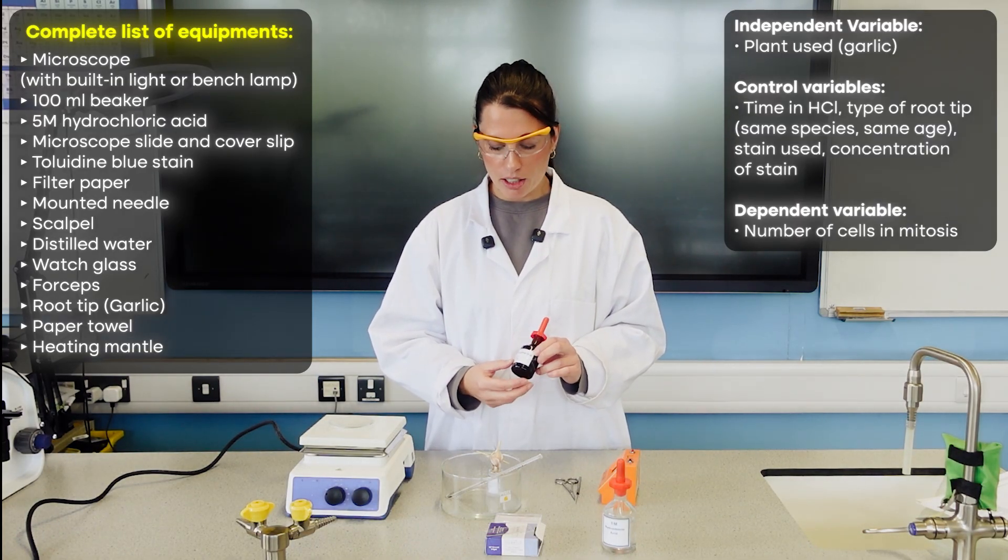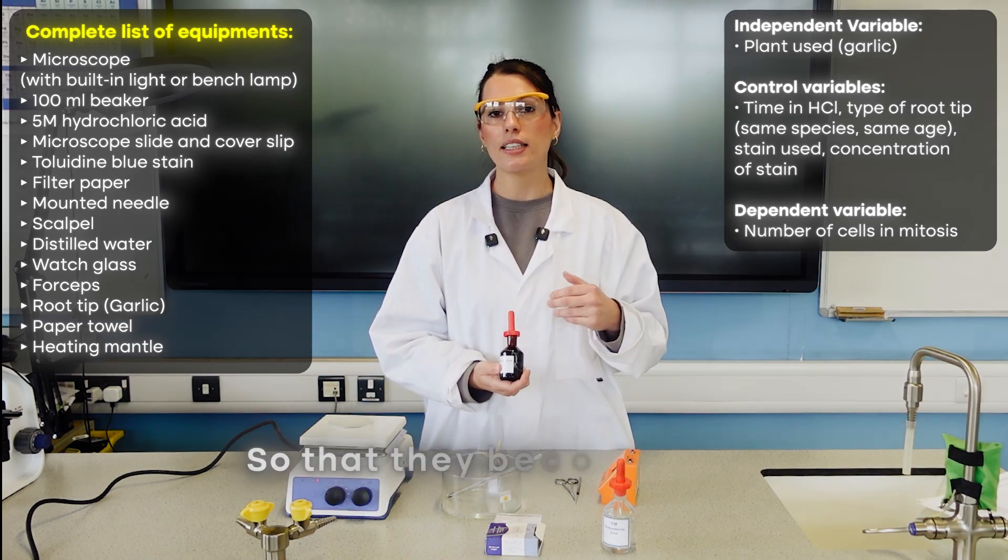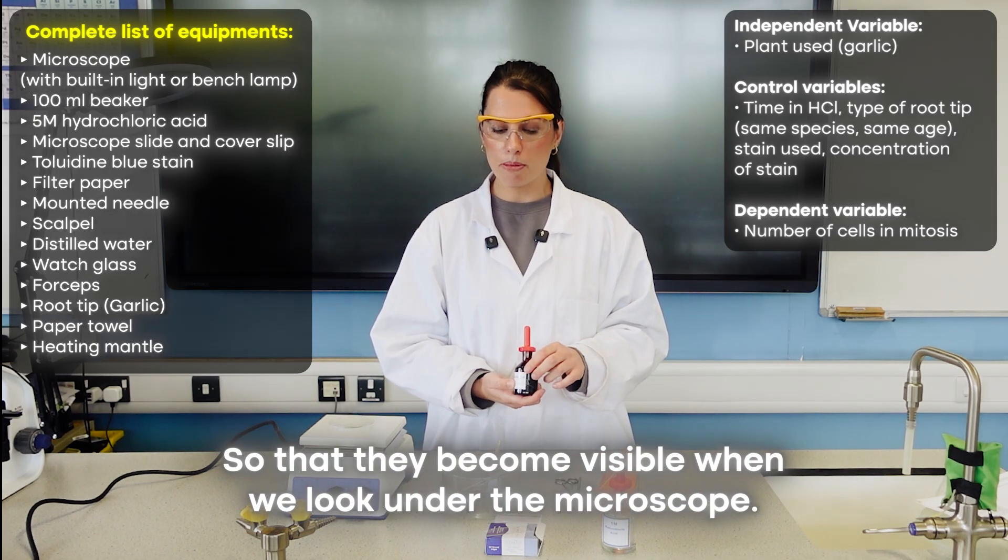That takes us to the stain. I'm actually using toluidine blue for this, and this will stain the chromosomes so they become visible when we look under the microscope.